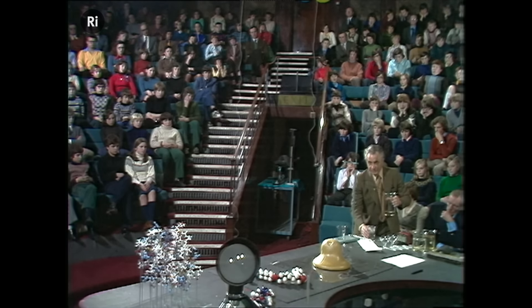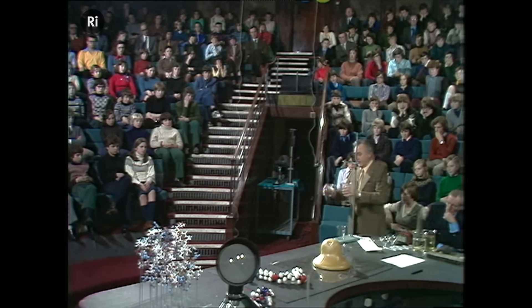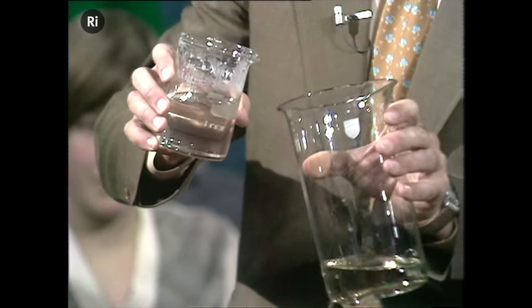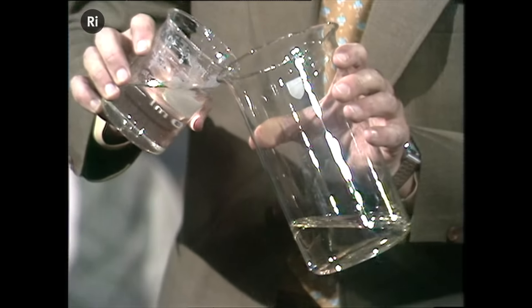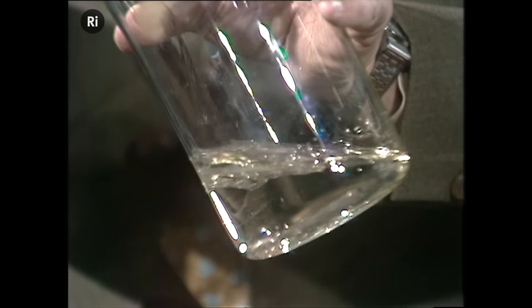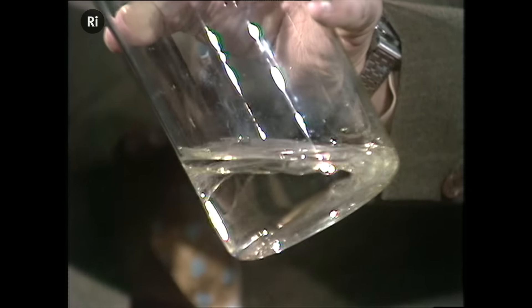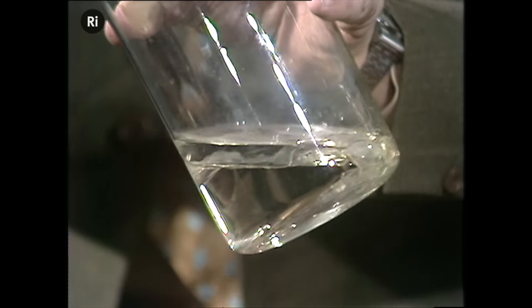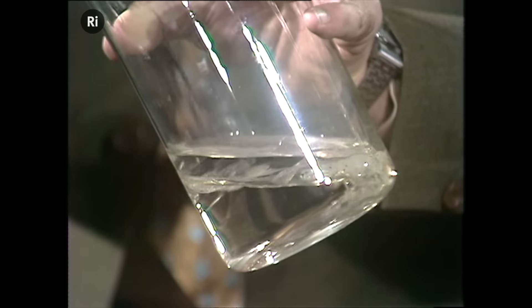And this is dissolved in water. This is the other one, the hexamethylenediamine, which I'll pour on the top of this first layer. And you can probably see already perhaps a bit of hydrogen chloride coming off, which we would expect from what I said.